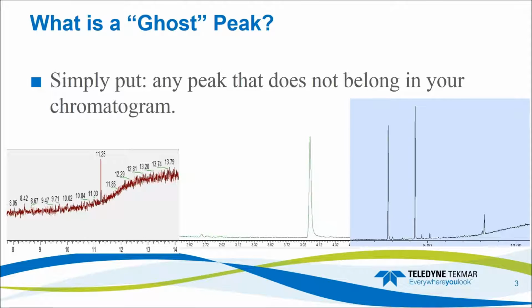So all kidding aside, ghost peaks can be a really troublesome issue, especially if they start to interrupt your calibrations or if they start to affect your low-end sensitivity. So what is a ghost peak? Quite simply put, it's any peak that does not belong in your chromatogram. So here, for instance, on the left side chromatogram, this is simply a system blank. No injection made on this GC, and we see a nice sharp peak right here, which just so happens to be naphthalene. And that would be an example of carryover. Clearly stands out, it doesn't belong.